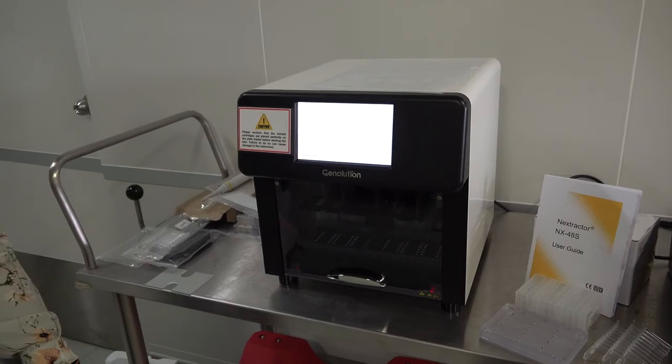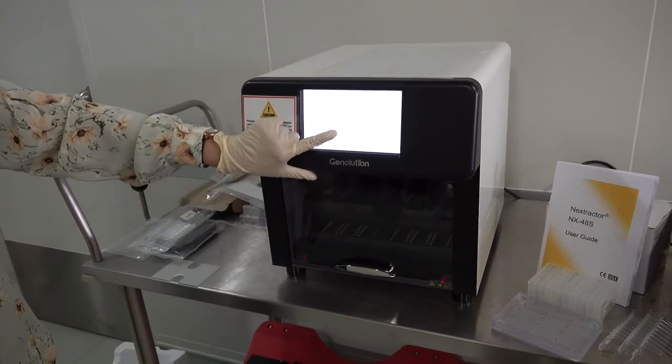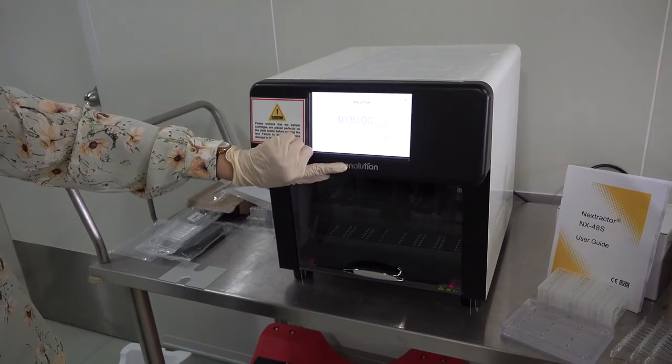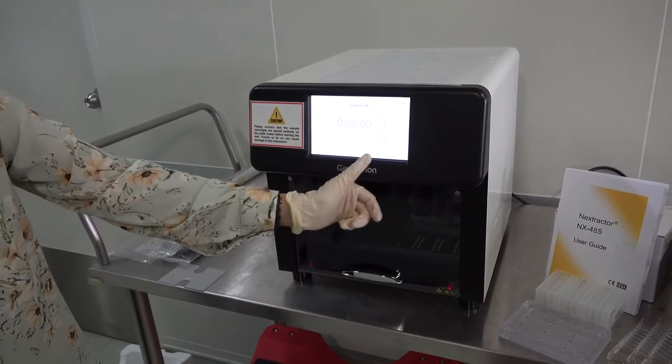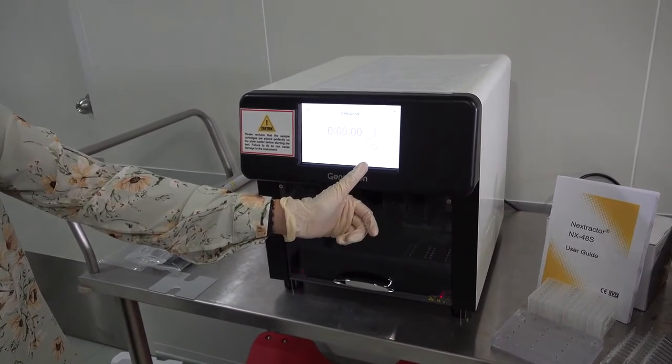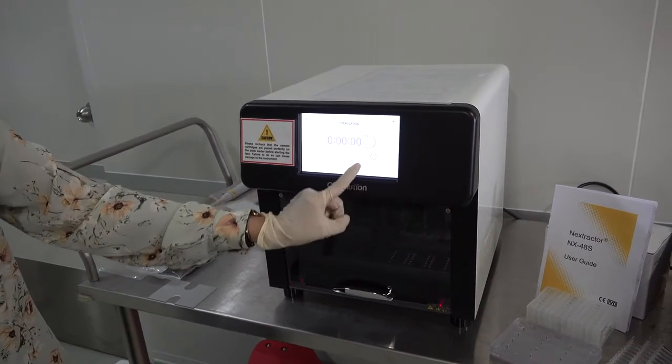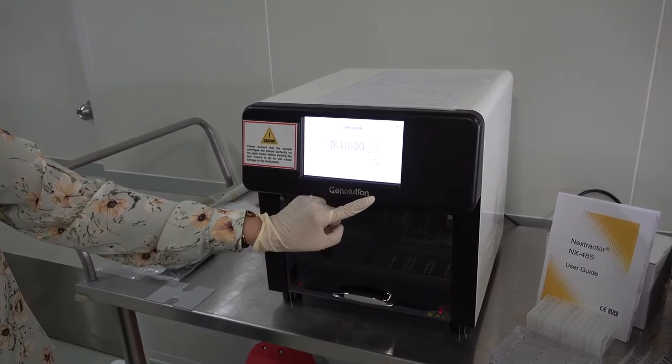We will first begin with the procedure of sterilization. You turn on the sterilization button. You are given various options from 5 to 10 minutes and generally the procedure is 10 minutes. You click on 10 minutes and then you start.